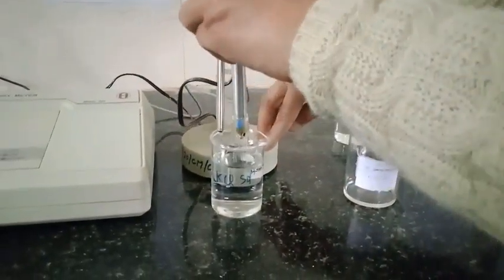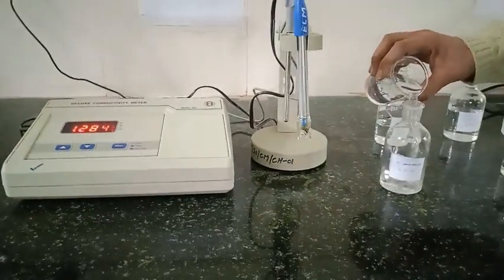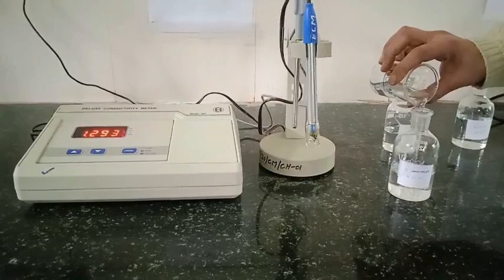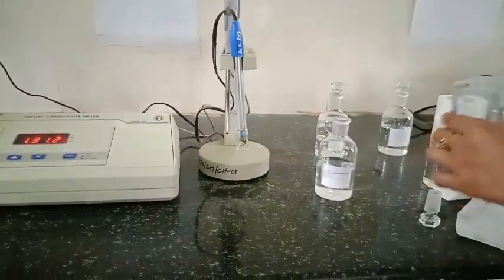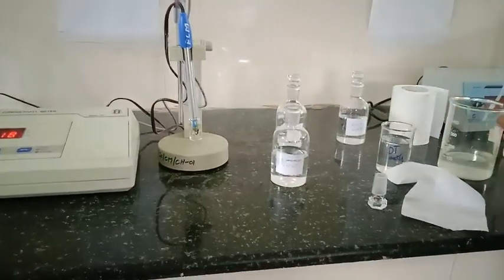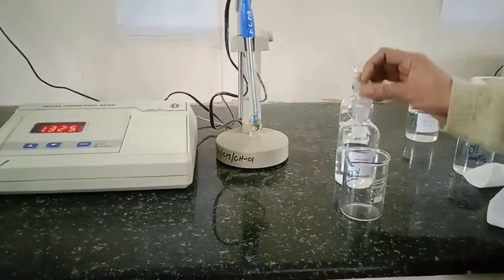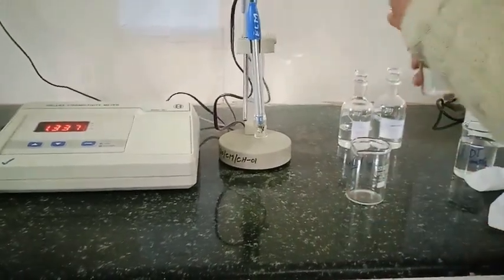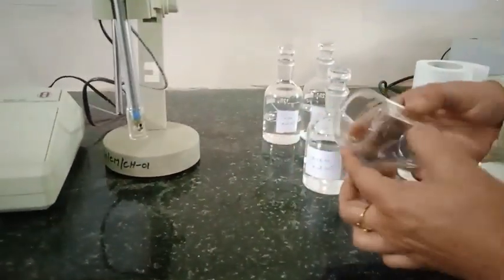As I mentioned, this reagent bottle can be used for one month. After transferring the solution back, I am going to wash the beaker first. The next solution to measure is 0.01 molar, so I first wash with water. Here we have the next solution which is 0.01 molar KCl. Before transferring the whole solution I am just going to rinse it first, and after rinsing I will transfer the whole solution into the beaker to determine the conductivity.